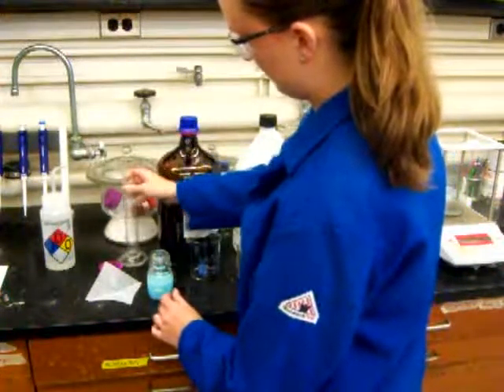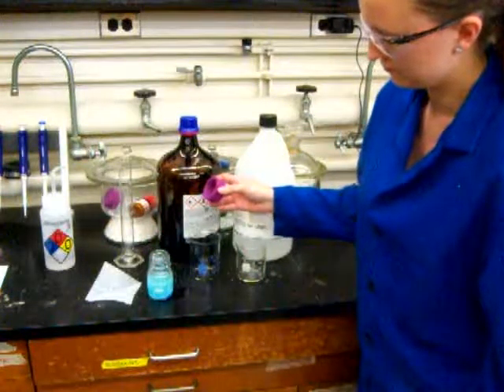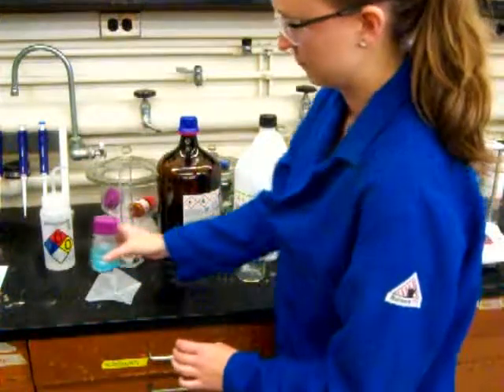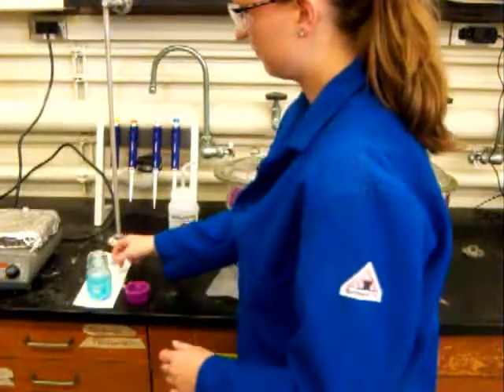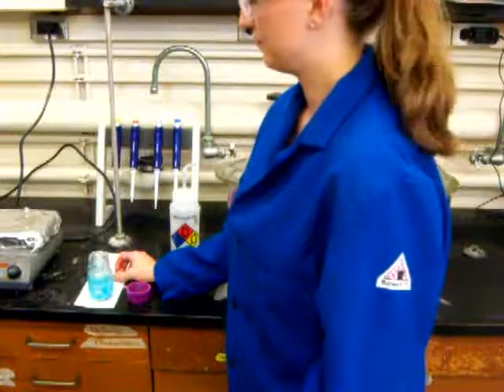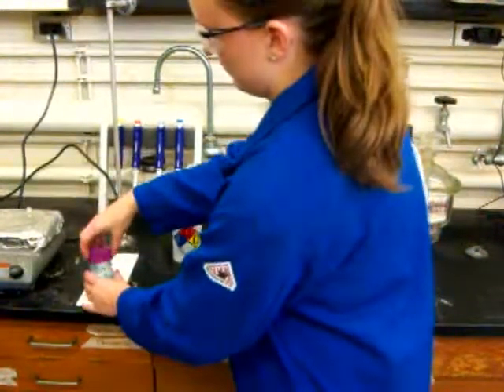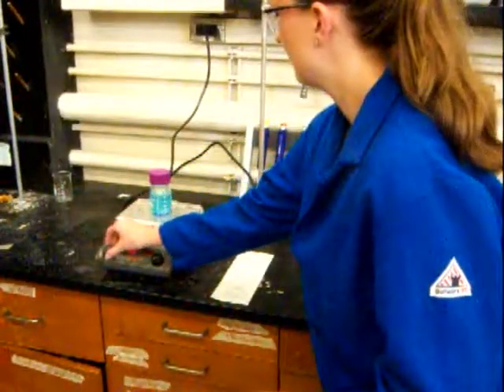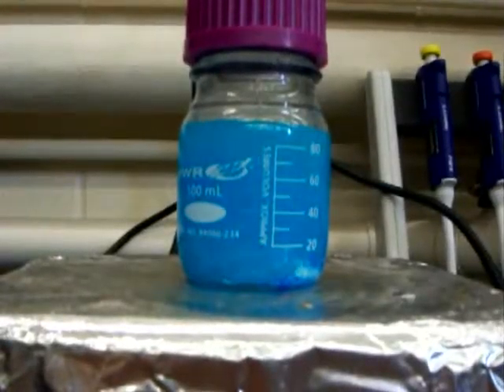And you can see now that the mixture is sort of cloudy, turning a little bit blue. The blue color, again, is due to the copper salt. But in order to get everything to become a homogeneous, a clear solution, we need to mix it up. Right? And it turns out we don't have a KitchenAid mixer available to blend everything. So instead, we're going to use a stir bar, a magnetic stir bar, and a stir plate. So Katie will cap the jar, put it on the stir plate, and let the mixture stir for 5 or 10 minutes until everything's completely dissolved.